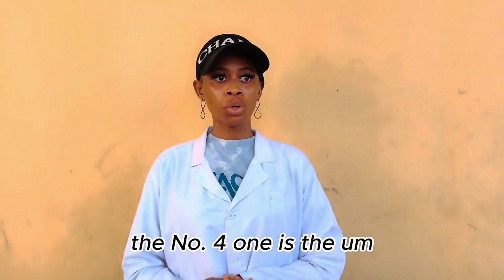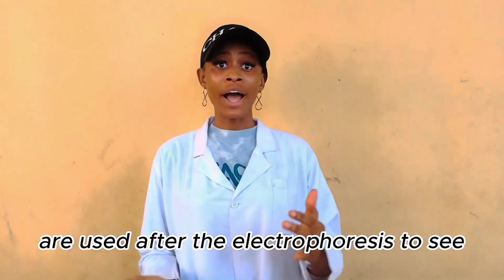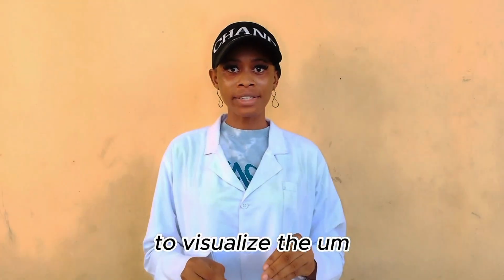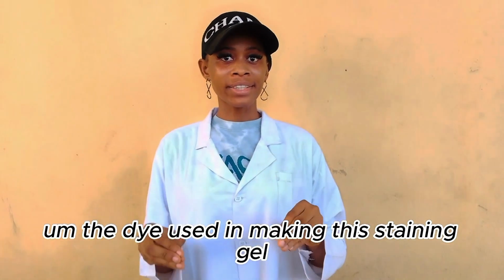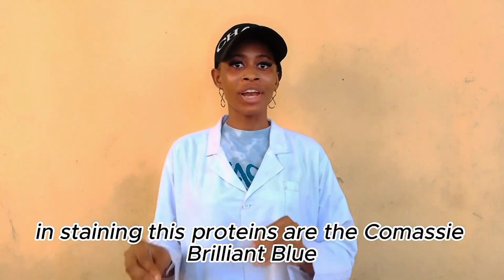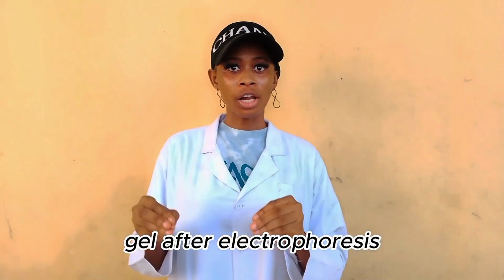Then the number fourth one is the staining solution. The staining solution is used after the electrophoresis to visualize the protein bands. The dye used in staining these proteins is the Coomassie Brilliant Blue or the Coomassie Blue. It is used in staining this gel after electrophoresis.